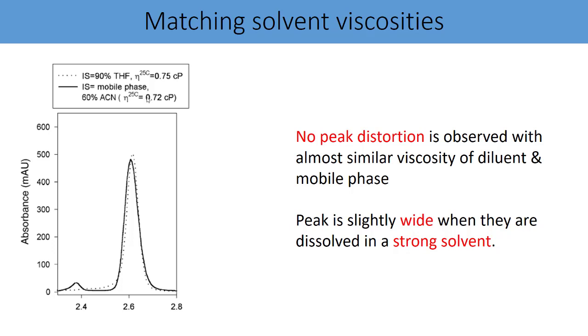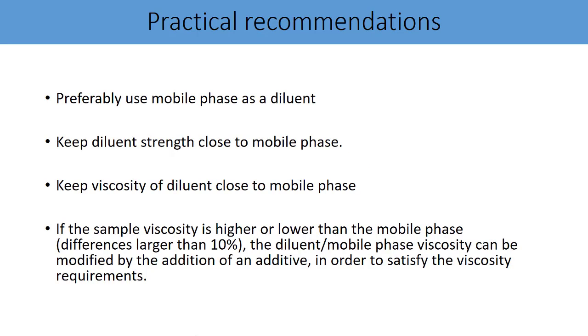Peak is slightly wide when they are dissolved in a strong solvent like THF. You can see a little fronting to the peak shape, but it is because of the THF, which is a very strong diluent. But overall, the peak shape is very much acceptable. The important points that we must consider: preferably use mobile phase as a diluent. In case you are not able to use mobile phase as your diluent, keep diluent strength close to mobile phase, or if possible a little less than the mobile phase strength. Keep viscosity of diluent close to viscosity of the mobile phase.